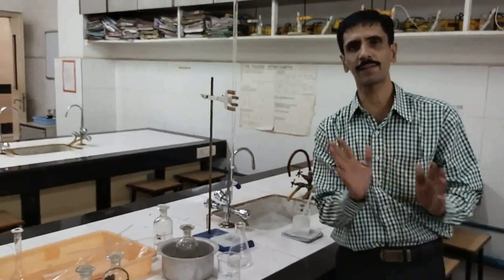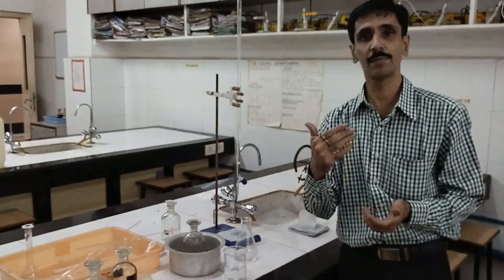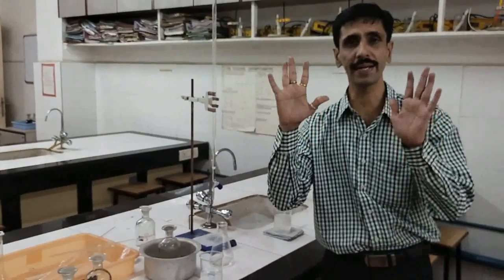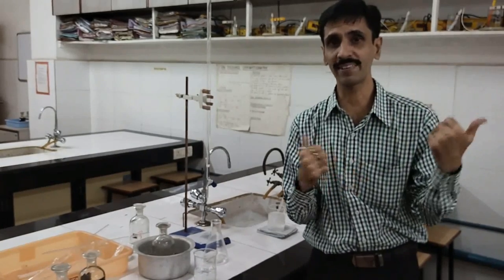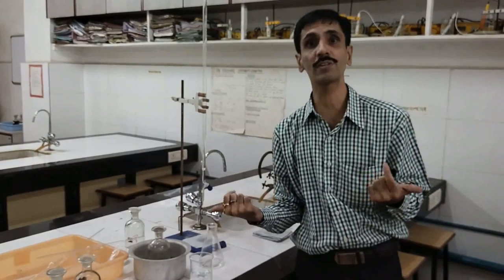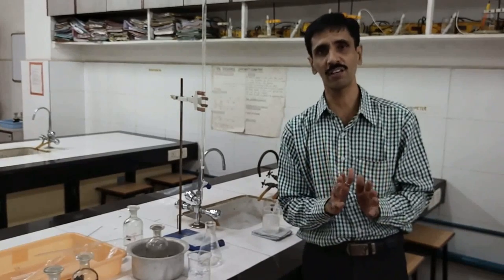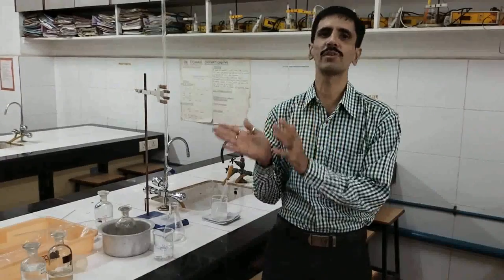In this way, repeat the procedure for intervals of 20, 30, 40, and 50 minutes, giving you 5 readings in total, all measured from zero time of 3:00 PM. Once the entire Set 1 experiment is complete, proceed the same way for Set 2.